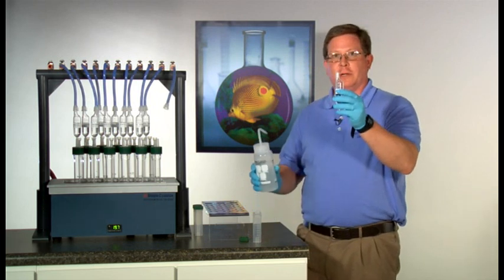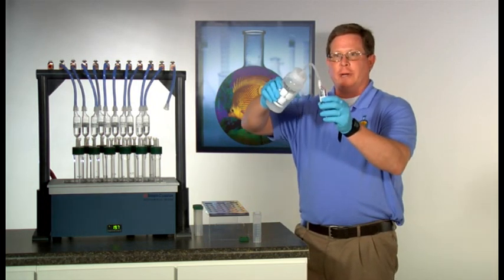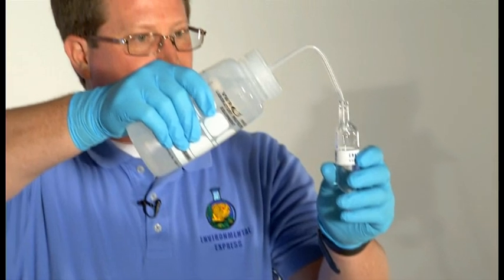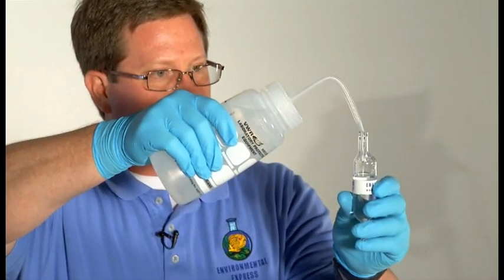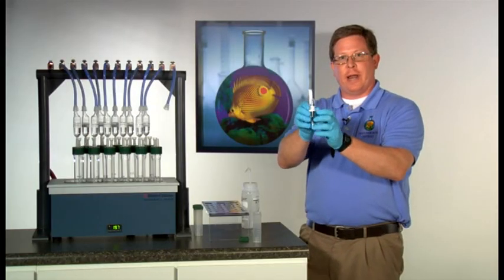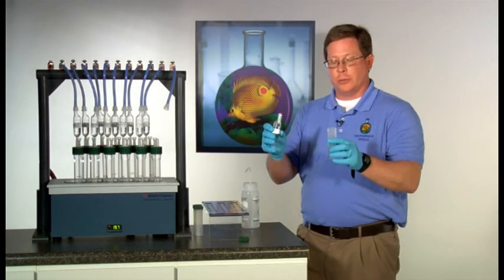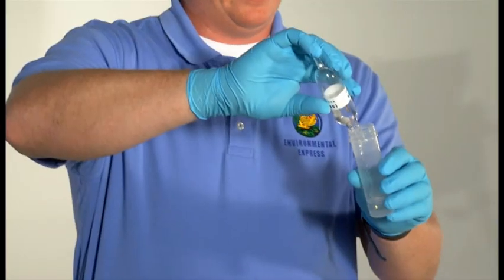Fill to the 25 milliliter fill line using the appropriate catch solution. You may now cap the top of the trap for analysis or transfer into another collection device.